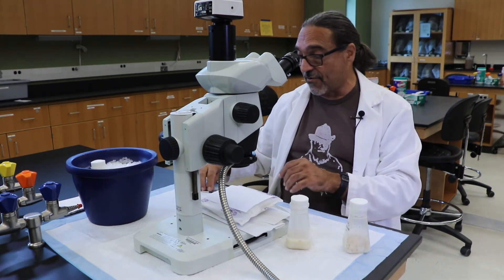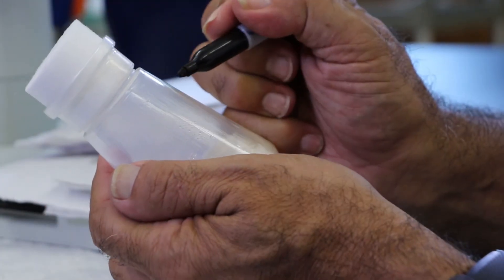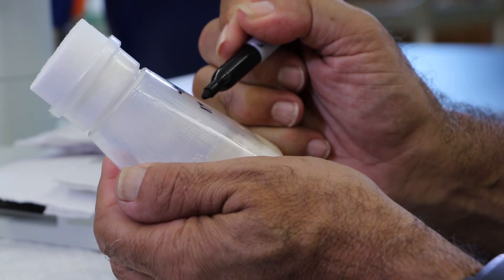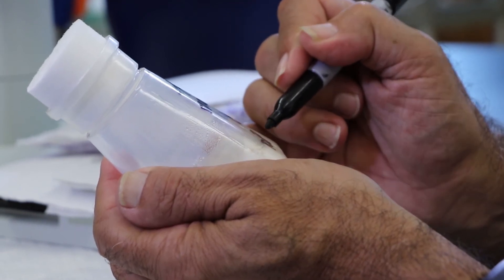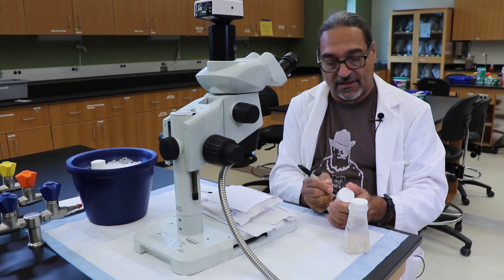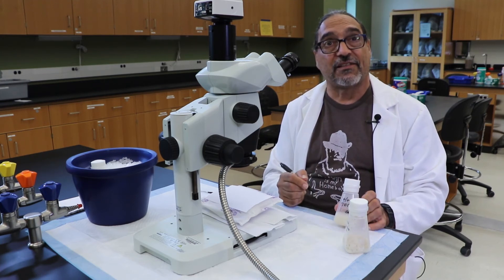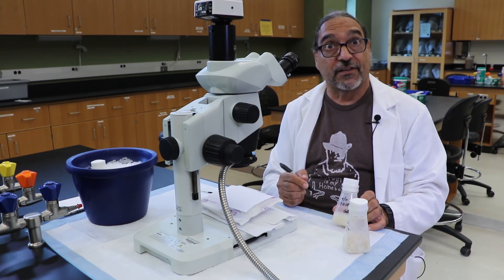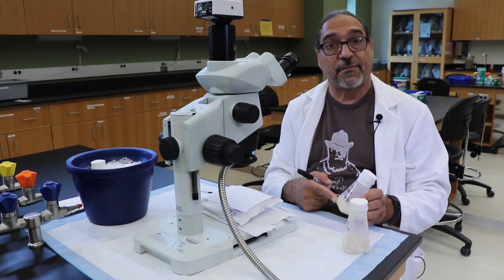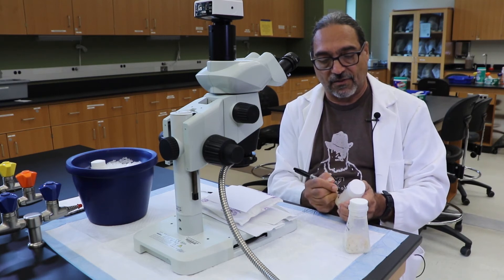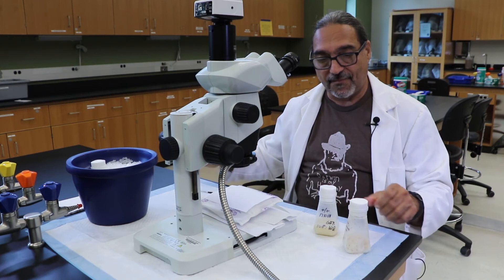While you're waiting for your two minutes to progress, you need to label your vial. And so the new vial, we have a new stock vial right here, and we are going to label it with the genotype. These are wild type flies, and so we indicate that they are wild type by using the plus-plus designation. We also want to place the date on the vial, and then always put your initials on the vial because that tells any of the investigators or the class or the professor who actually made the vial of flies. Notably, we're going to fill this vial with 10 males and 10 females, and so we're also going to indicate on the vial the number of males and the number of females used to make up the mating. And now we wait two minutes.